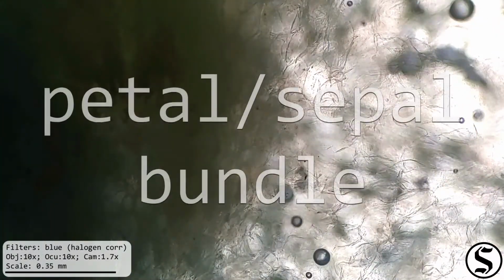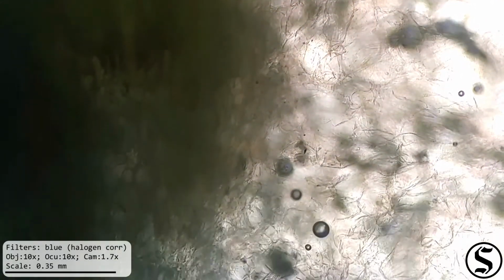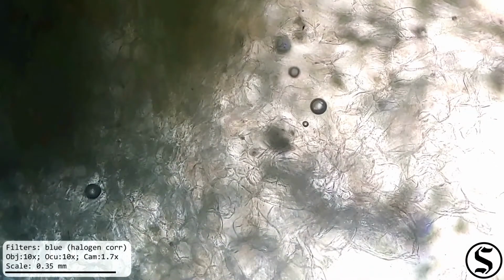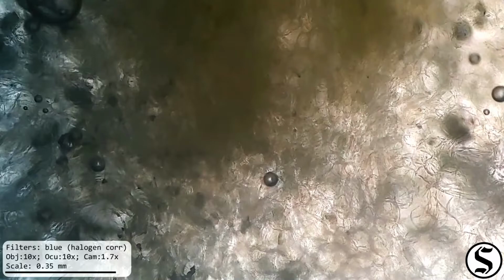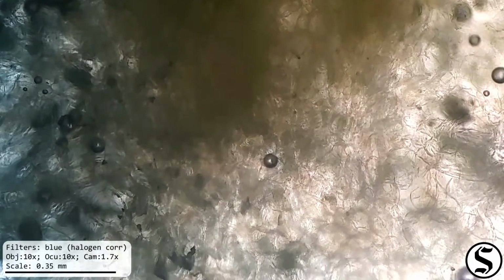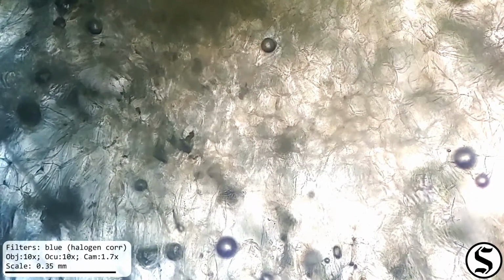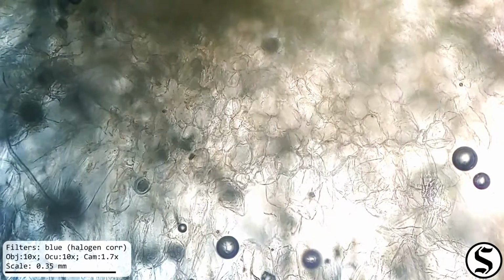Now on to the second sample slice. As we continue inwards, don't mind the bubbles trapped in the flesh of the apple, we come across a petal or sepal bundle. Petal is from the Greek petalon, leaf or petal, and sepal is a new Latin construct mashing together separatus for separate and petalum for petal. Those are little green petals underneath what we normally think of as the flower.